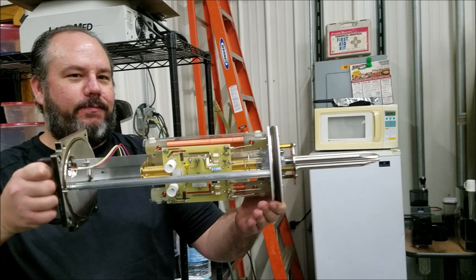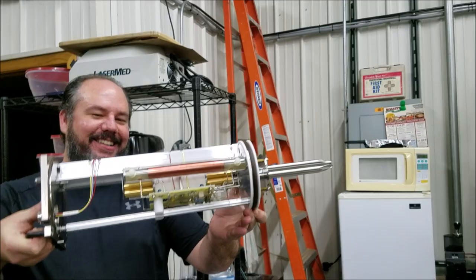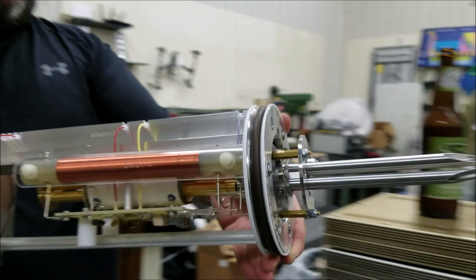We'll get the money shot eventually. Ready for extraction — here we go. Welcome to the Mark 9000 laser weapon. That's crazy — that's pretty cool looking.